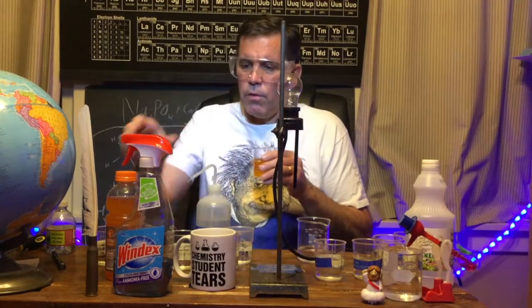A lot of drinking waters are simply deionized water with nothing in them at all. Let's look at something else you might like to drink: Gatorade. Does Gatorade have ions in it? Let's see — yeah, quite a few. In fact, Gatorade is what replenishes these ions in your system, called electrolytes. You need electrolytes — those are substances that conduct electricity when dissolved — in every single cell of your body. Your cells work because of electrolytes; you are an electrical person.